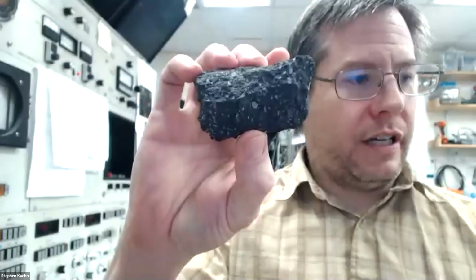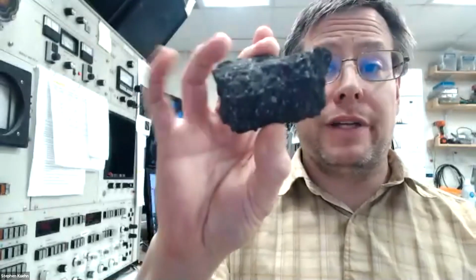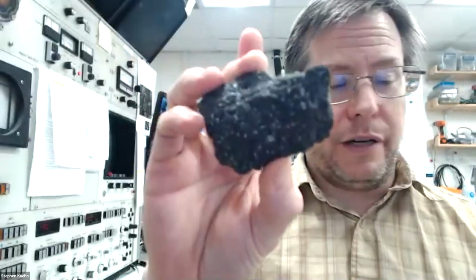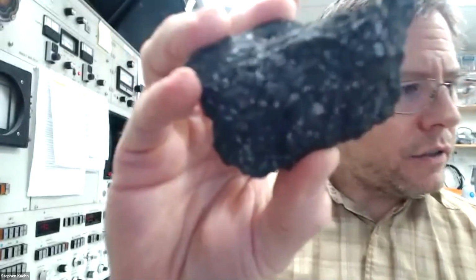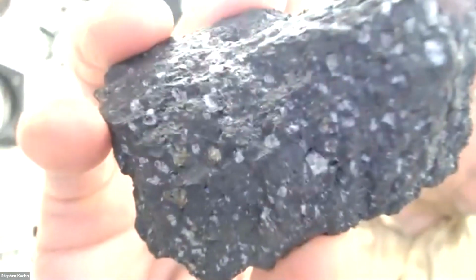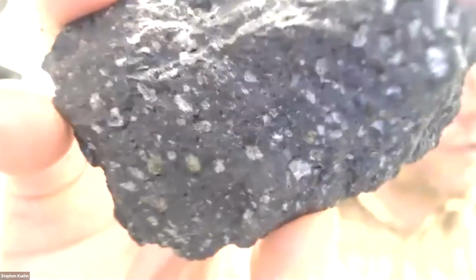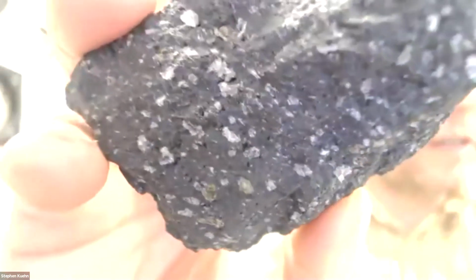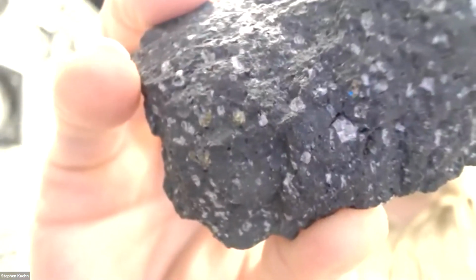And so you can see it's a fairly dark colored rock. So that's a useful clue that it's probably a mafic rock. So you might want to write that down too. And there are, I don't know if you can see, yeah, if I get it close enough, there we go. You can see there's crystals in there. There's some white ones, but maybe a little harder to see. There also are some green ones. Okay. So that means there's at least 2 different minerals that are big enough that we can see.